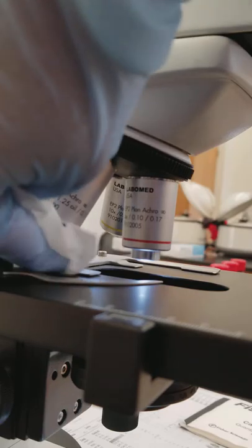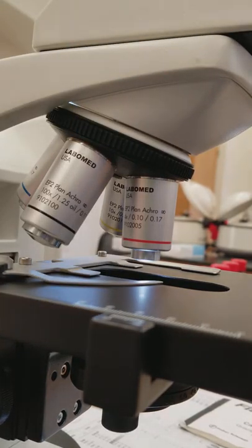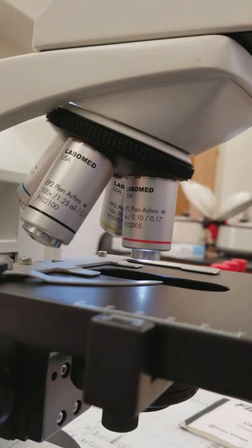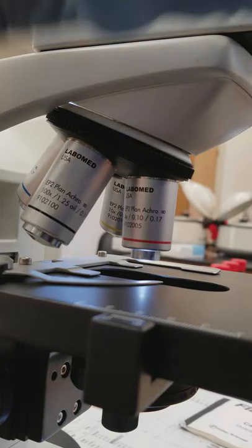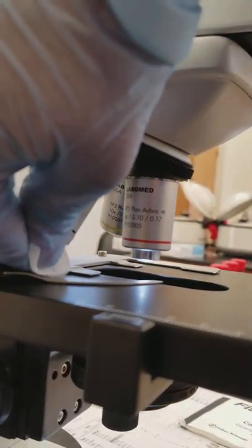You didn't see me do it but I wiped the oil off first, off the objective. Then I went and put the lens cleaner on there. I'll perform it again.